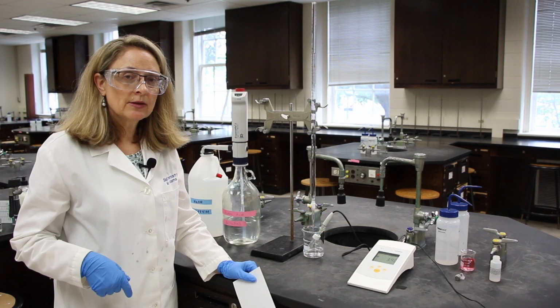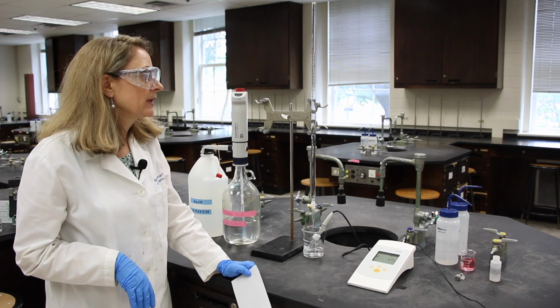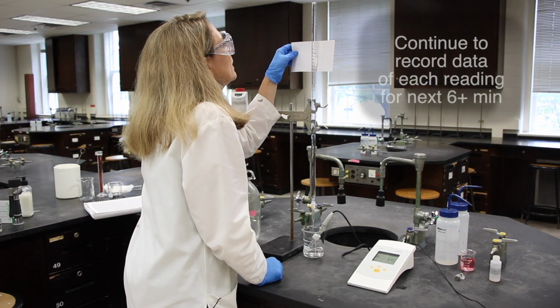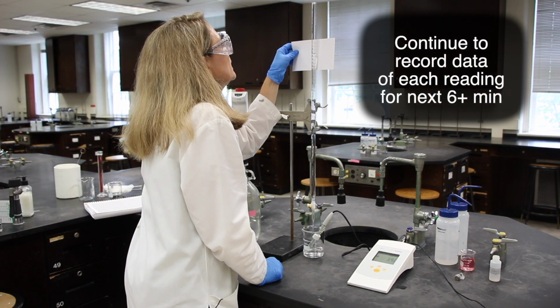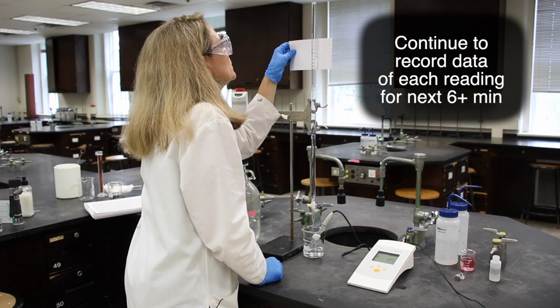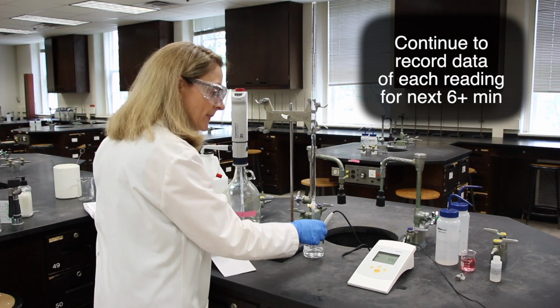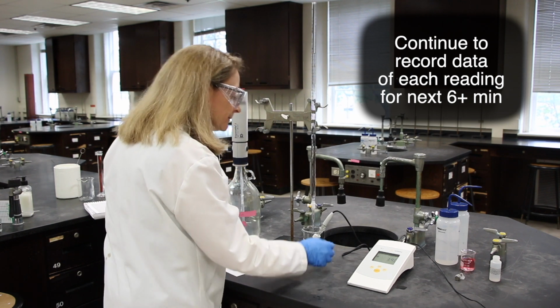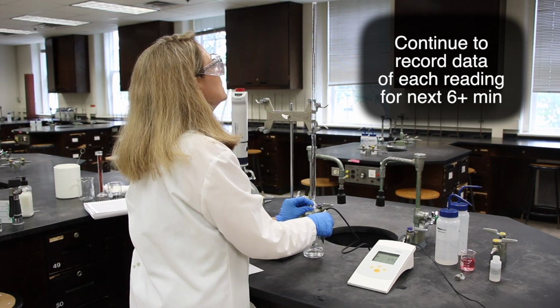I just drained another about 1 milliliter, so let me read that and the pH. The reading is now 11.25. And my pH reading is 3.90. I'll drain another milliliter.